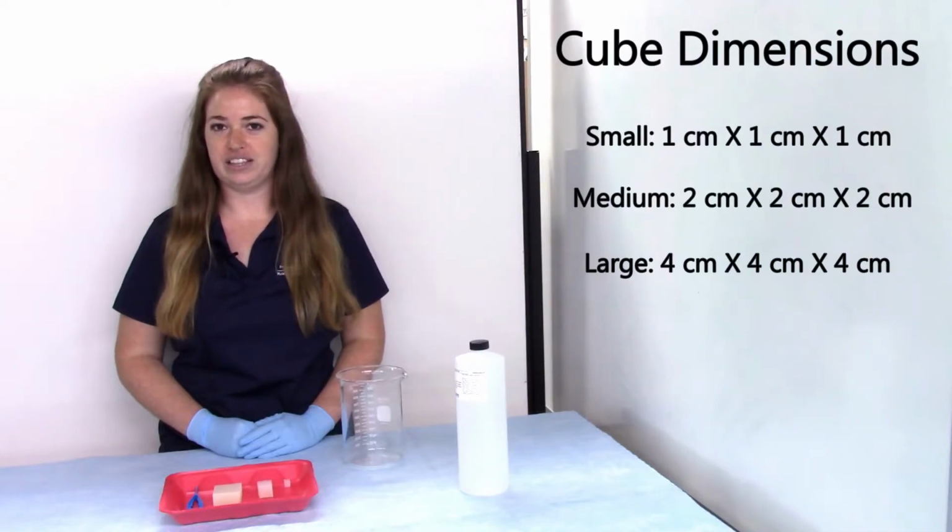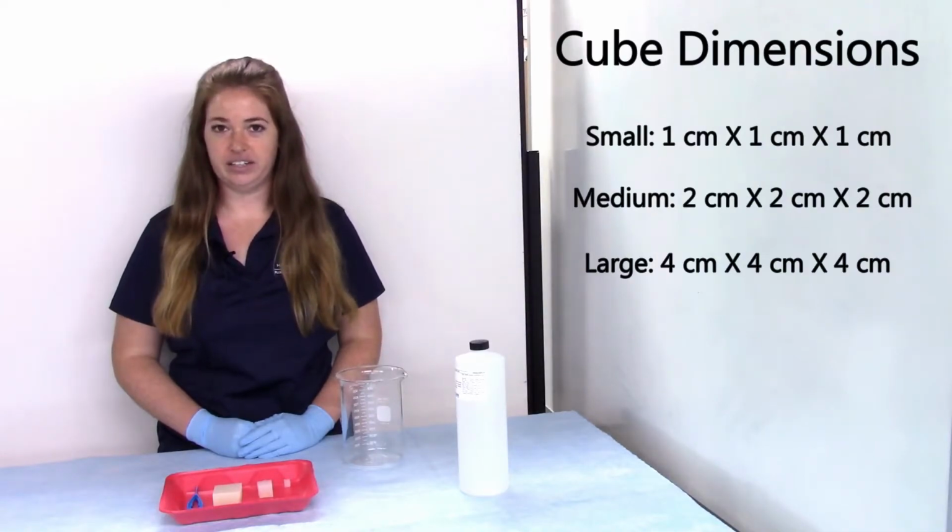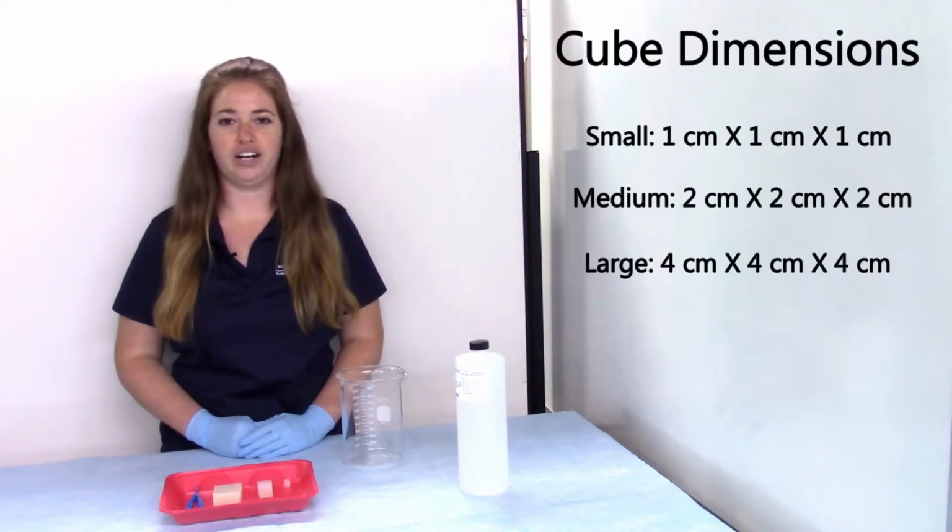Now, you may notice that these cubes aren't perfectly cut, but that's okay. These measurements are very close to what they are in reality. Before we get started with this experiment, make sure you record a hypothesis on your handout. If you need to, go ahead and pause this video to do that. One more thing, this experiment is going to show us why it's important that cells are small, so keep that in mind as you watch.